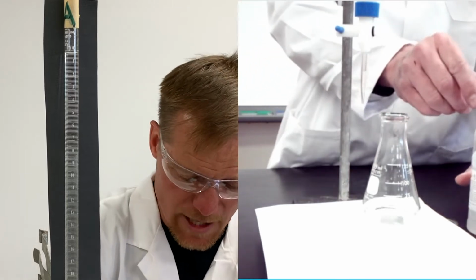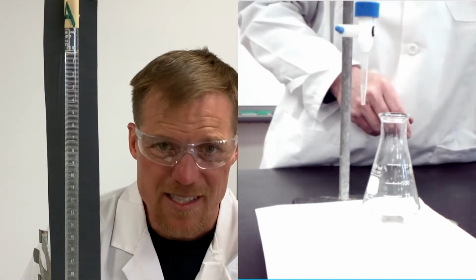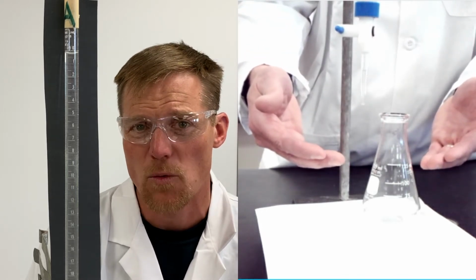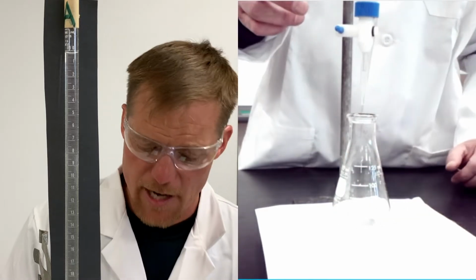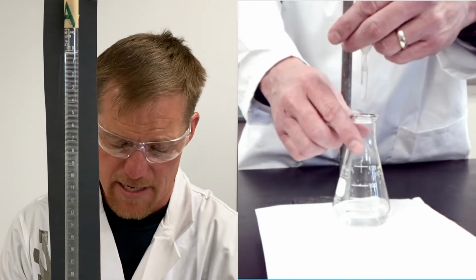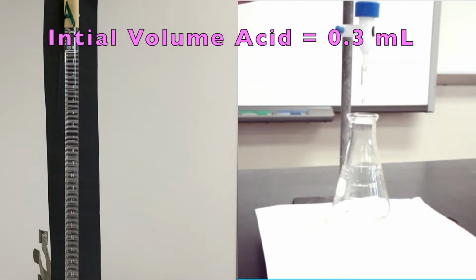Before I do anything though, I need to add 3 drops of phenolphthalein. Now the phenolphthalein is the indicator that we're going to use. 1, 2, 3. And that's going to stay clear when it's in water, and it's also going to stay clear when it's in our acid. So let's go ahead and add our acid. I'm going to actually take my hand, wrap it around the burette, and I'm going to add acid, and I need to move here so I can actually see what I'm doing. See how many milliliters of acid I'm adding. Remember, I'm at 0.3 right now, and I want to get down to about 15 milliliters. So I'm going to shoot for 15.3.